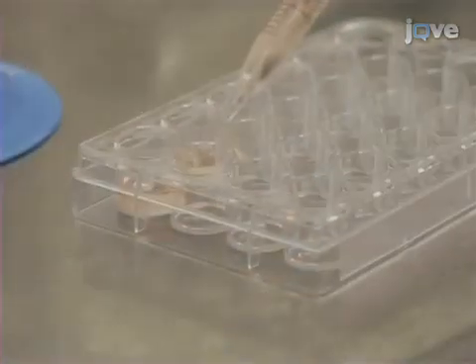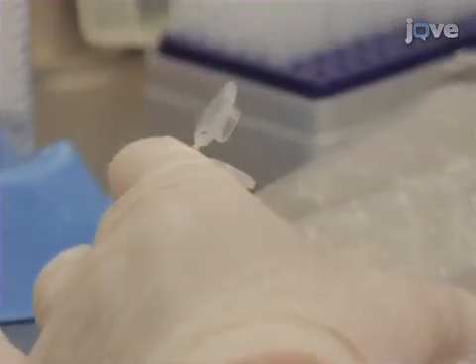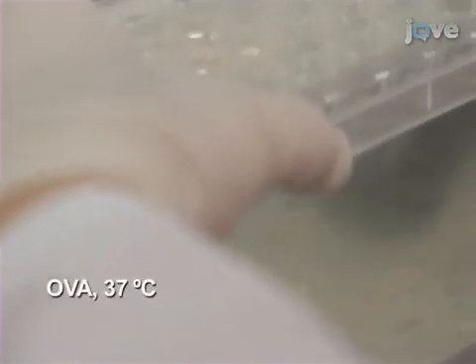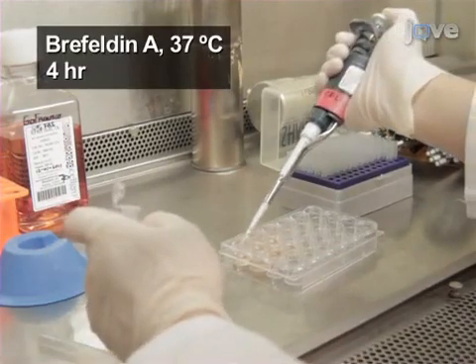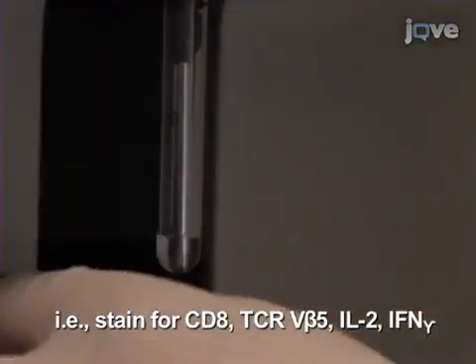Mix the isolated CD8-positive T-cells with irradiated splenocytes from a naive C57 Black 6J mouse at a 1:10 ratio and pulse the co-culture with 0.5 micromolar OVA for 40 hours. Thereafter, add Brefeldin A to the cells for another 4 hours. Finally, evaluate the cell populations by flow cytometric analysis.